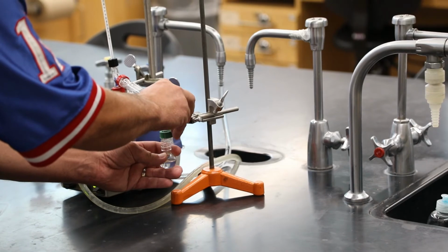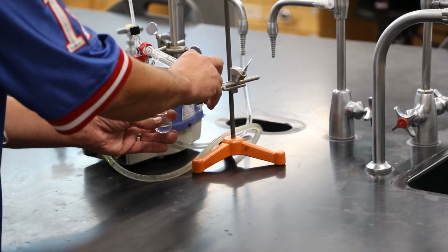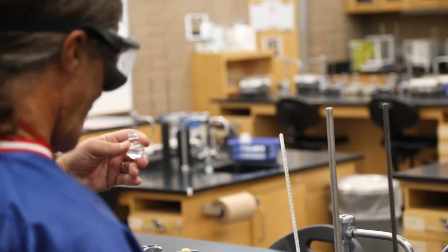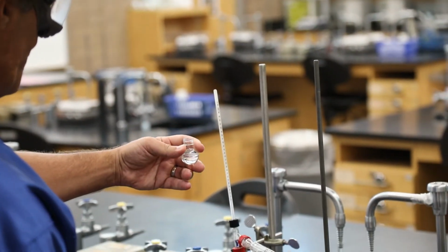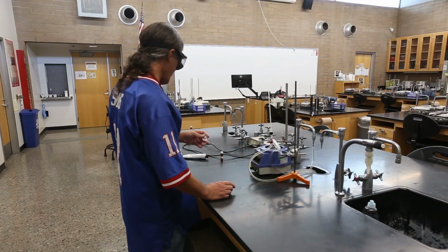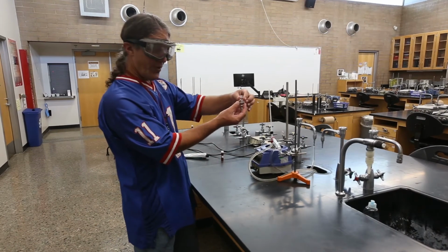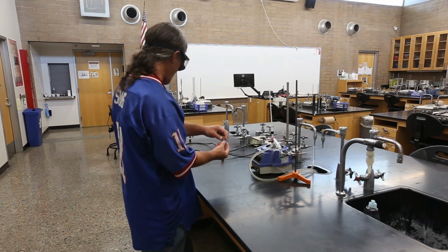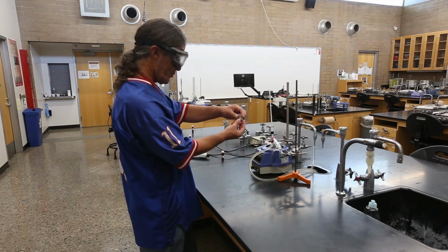And this is where you want to be very careful, because if you spend a lot of time making this stuff and now we just purified it and identified it, the last thing you want to do is drop this flask and lose all your glorious product. Since it's round, if we just put it on the bench, it's going to fall over. So we're going to probably want a beaker or something to put this in.